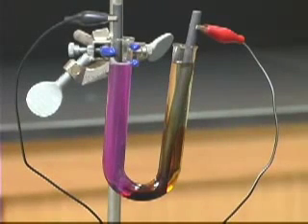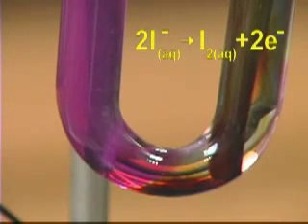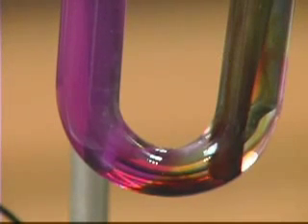At the anode, the iodide ion can be oxidized and is more easily oxidized than the water. So we'll see the solution turn a pale yellow to orange color due to the formation of iodine.